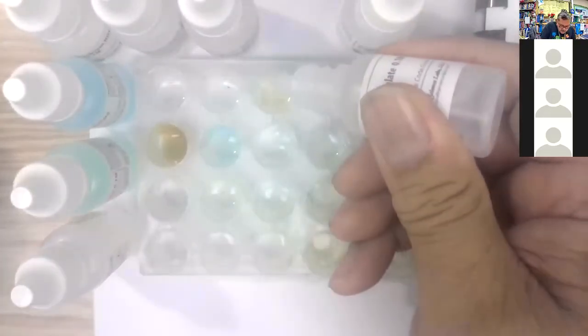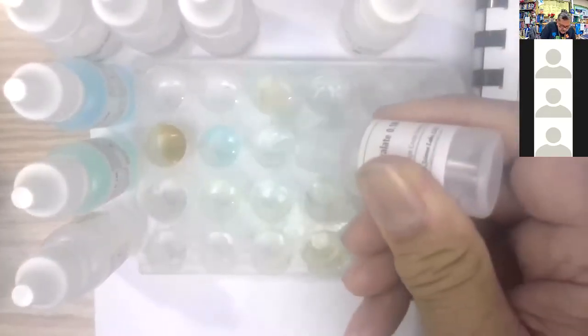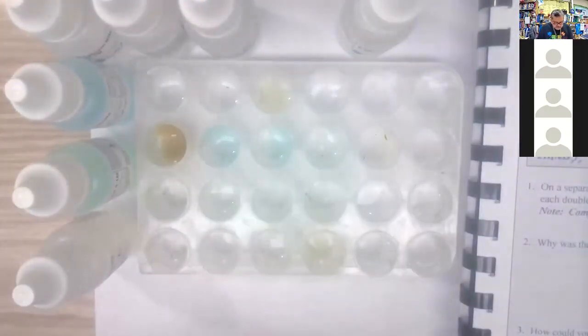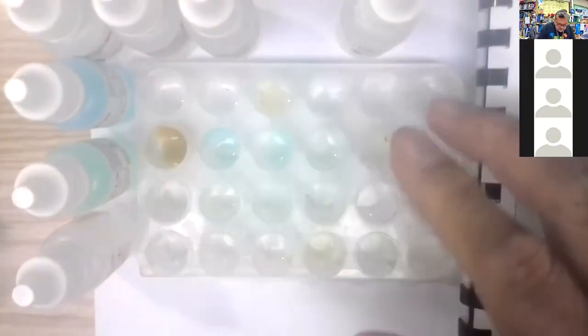All right, let's go with the sodium oxalate. Going down this way, shaking it up again. Going to the third column, 3 drops in each of the wells. Here we go. Ready? 1, 2, 3. Powdery white. 1, 2, 3. Kind of blue. 1, 2, 3. Not really. 1, 2, 3. All right. So significant color changes. White here, blue here. This one goes from clear to white. This one is going from clear to blue.